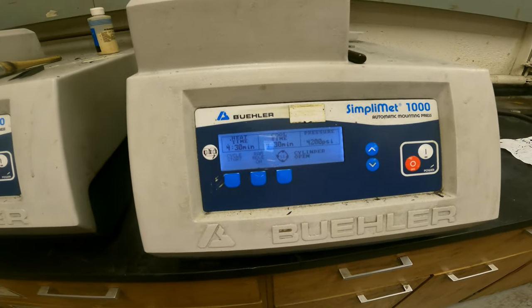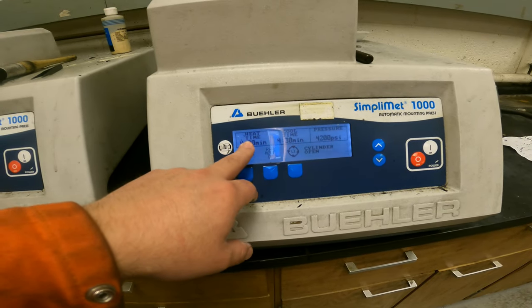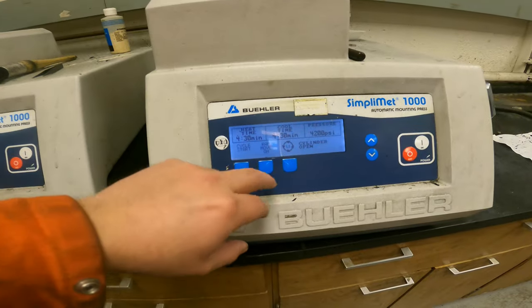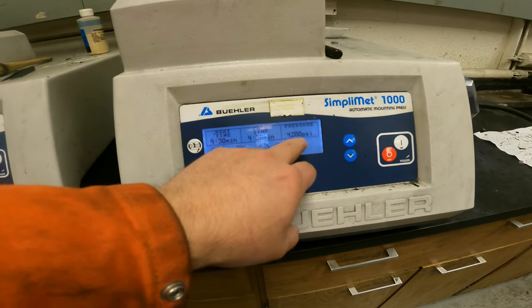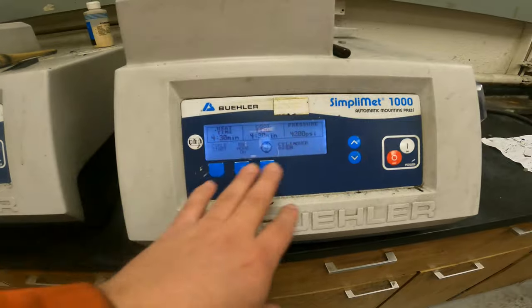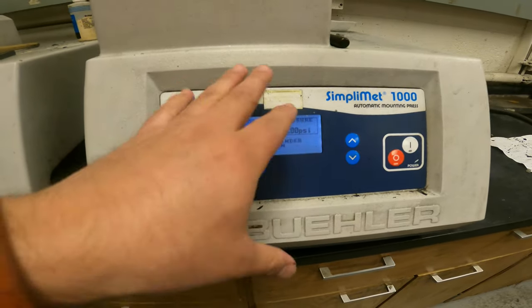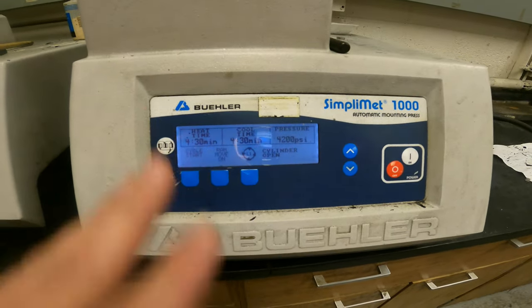So basically, we don't need to change anything in the menu. The machine does preheating, compression, and cooling time, and this is the pressure. That's set, we don't need to change any of that. For some reason, if this is not configured properly, let me know so we can reset all these parameters, but they're already set.